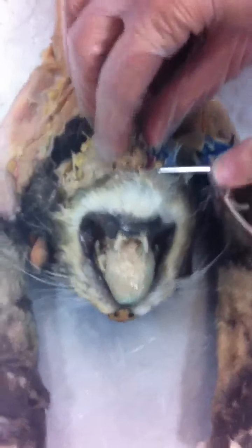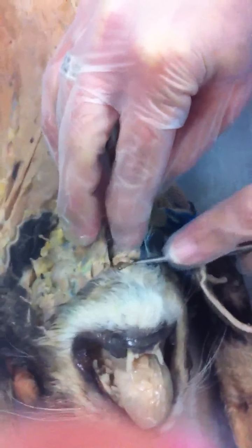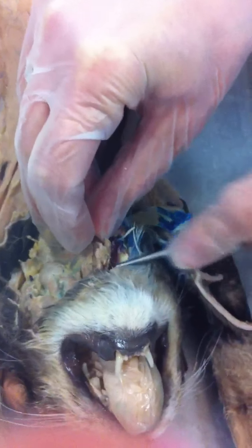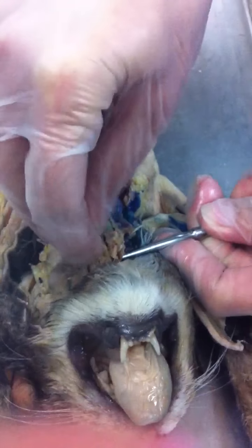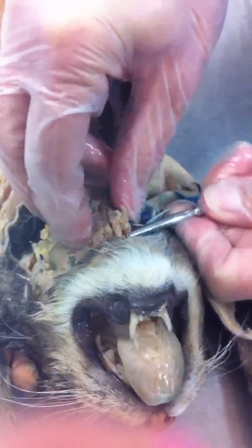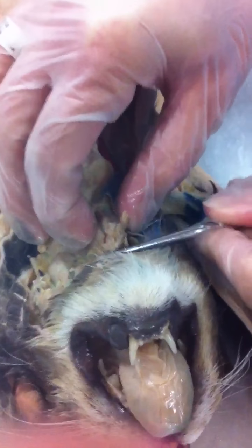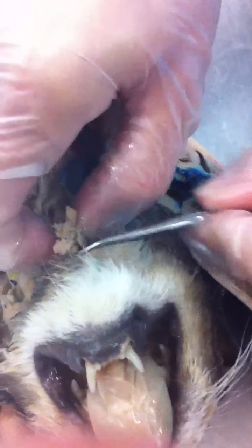If we go into the throat, there is a flap of cartilage that appears to have been cut. I think just when they cut the voice box to get to the cords, the flap got cut in half too. Okay. So the flap of cartilage up here is the epiglottis. It's just in two different pieces, so it's hard to see on this one.